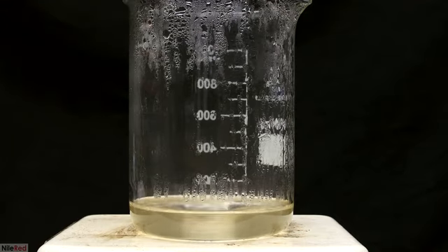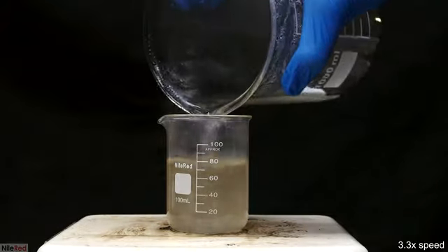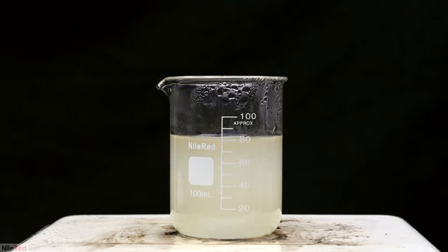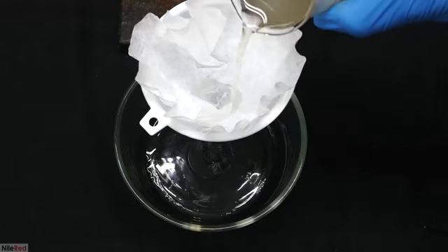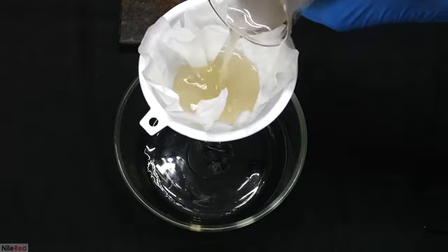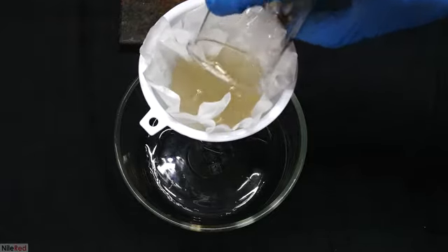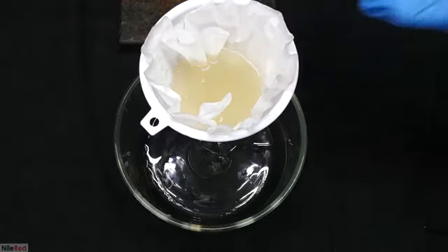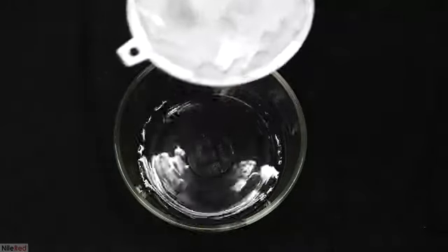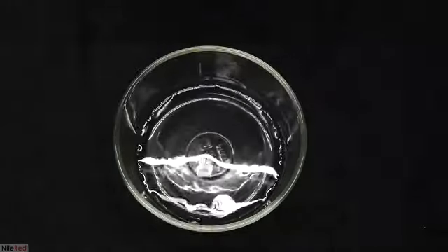Once the volume was at around 100 milliliters, I transferred it to a smaller beaker. It was further boiled down until about 70 milliliters, and then it was taken off the hot plate. I let it cool down to room temperature, and then I transferred it to a bowl to evaporate. To separate off the white powder, it was pretty easy, and I just filtered it through a coffee filter. Once everything had filtered through, I was left with a nice and clear citric acid solution.